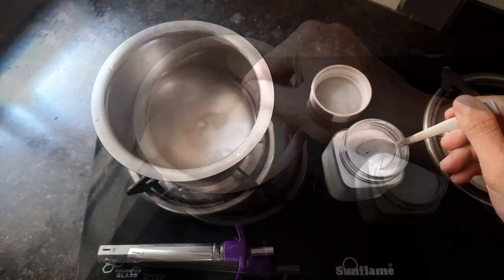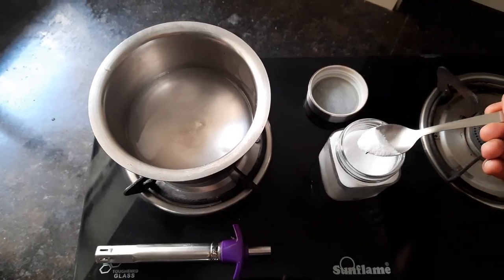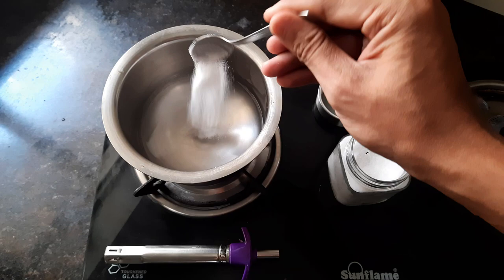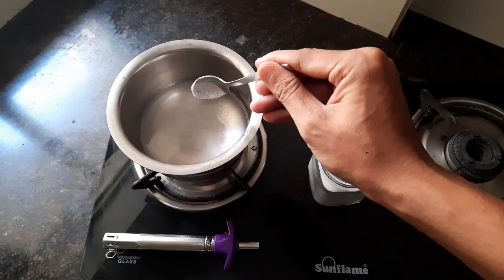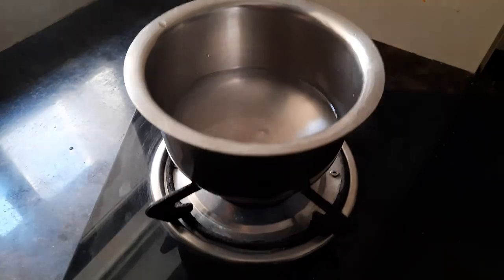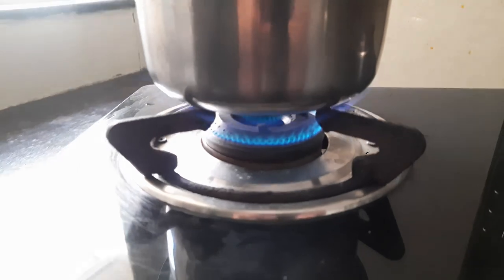My salt has dissolved, so I will add some more and then dissolve it again. I have dissolved all the salt.